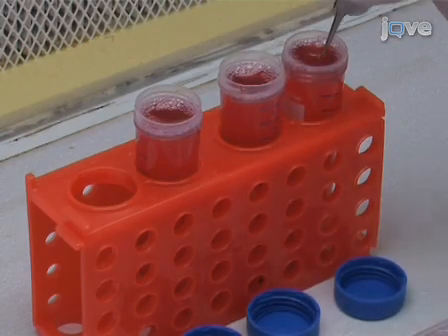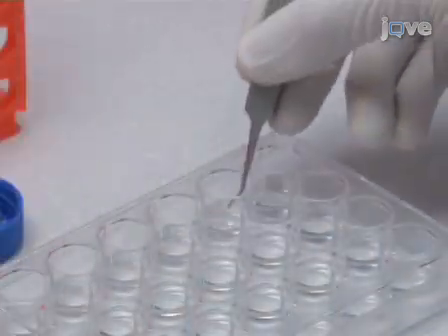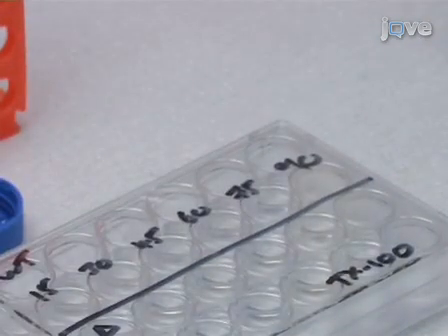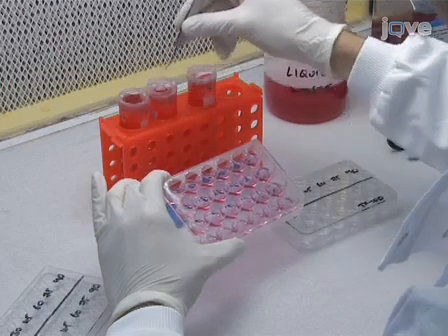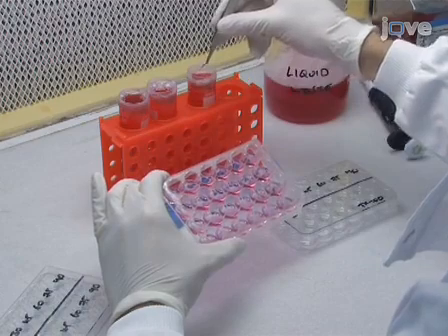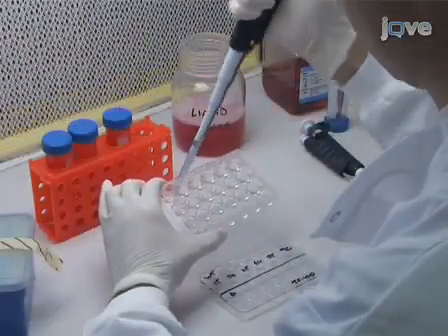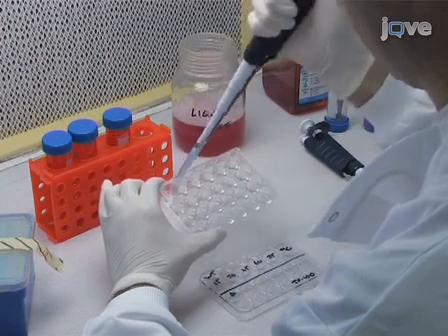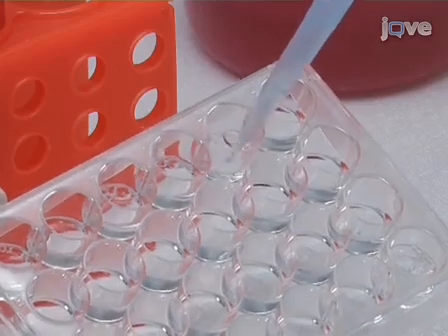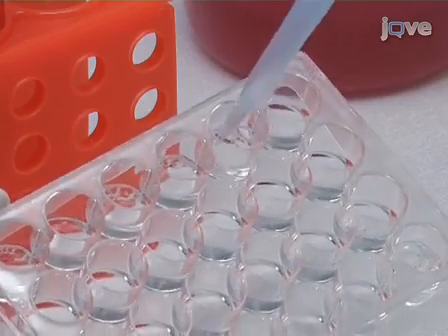Then, transfer them to a new 24-well plate containing 500 microliters of 0.5% Triton X100 in PBS per well. As previously, take care to keep the cell-covered side facing up. Vigorously rinse each cover slip with Triton solution by pipetting the liquid in the well up and down directly onto the cover slip so as to ensure that all the cells will be lysed and the intracellular bacteria released.